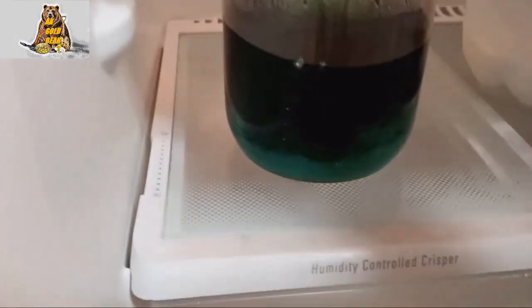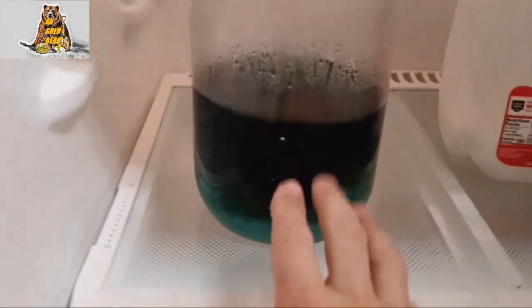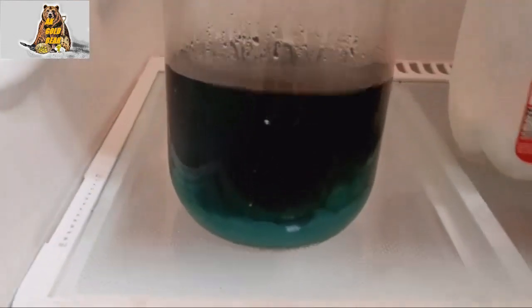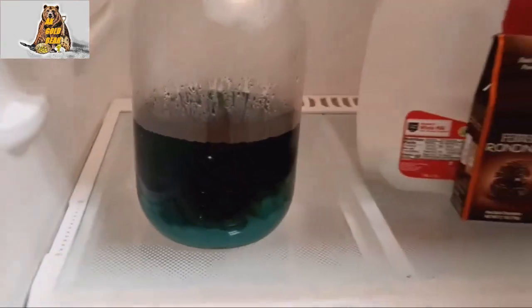Tomorrow morning there will be a lot of iron sulfate in the jar. After the night many crystals formed in the jar looking good.